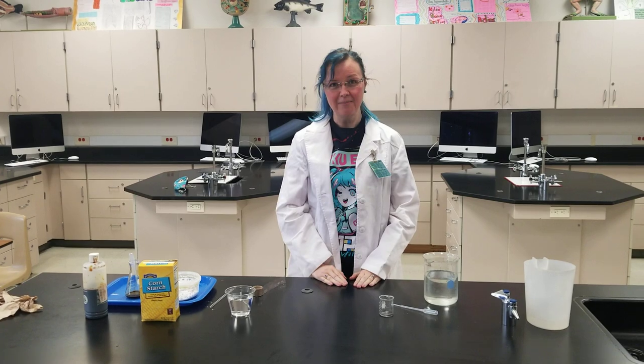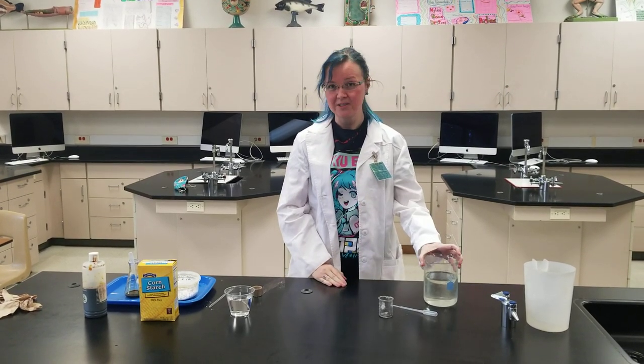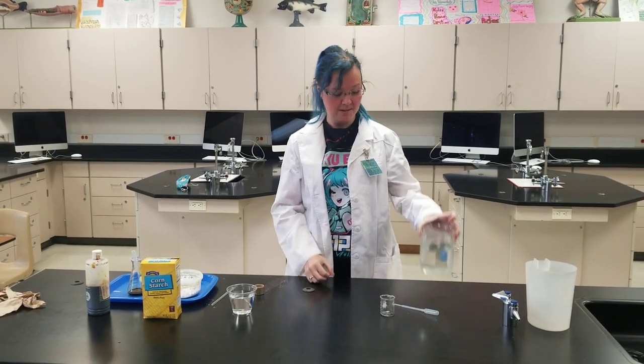Hi, I'm Mr. Roberts, and I'm going to be doing a dialysis demonstration for you today. So before we start the lab, I need to show you a couple of demonstrations so you understand the things that are going to happen.